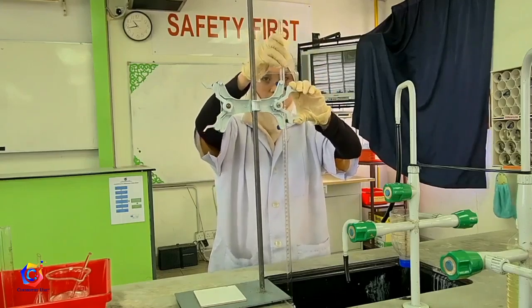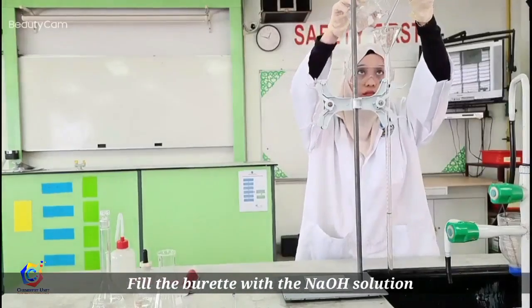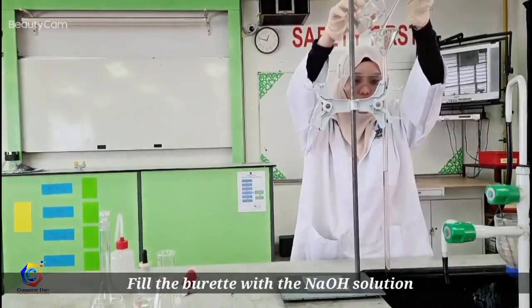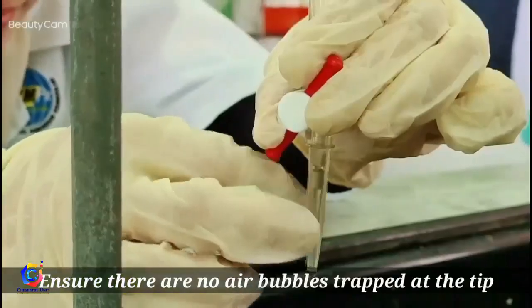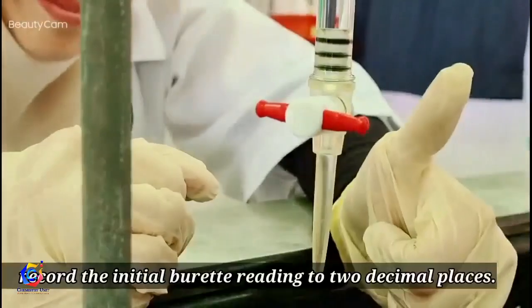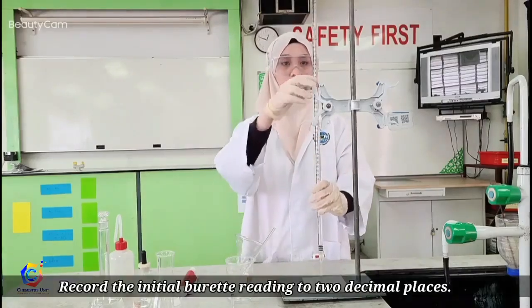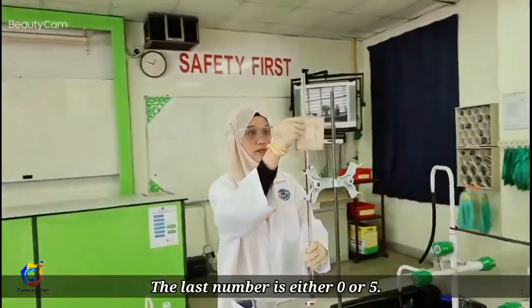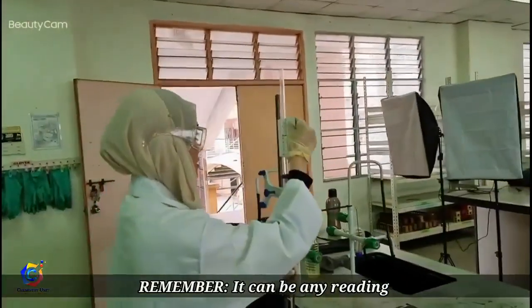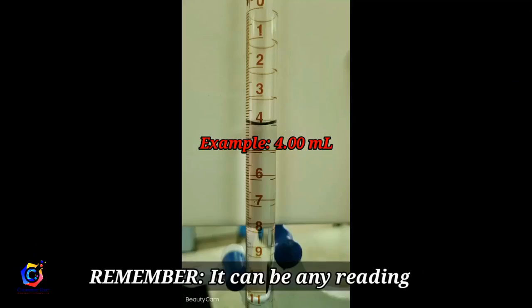Now fill the burette with the NaOH solution. Ensure there are no air bubbles trapped at the tip. Record the initial burette reading to two decimal places — the last digit is either 0 or 5. Remember, it can be any initial reading, not necessarily 0.